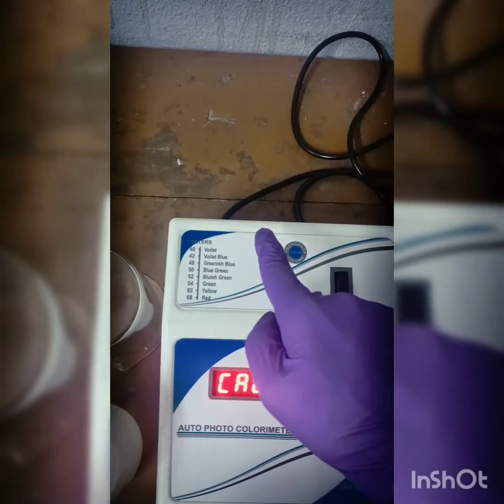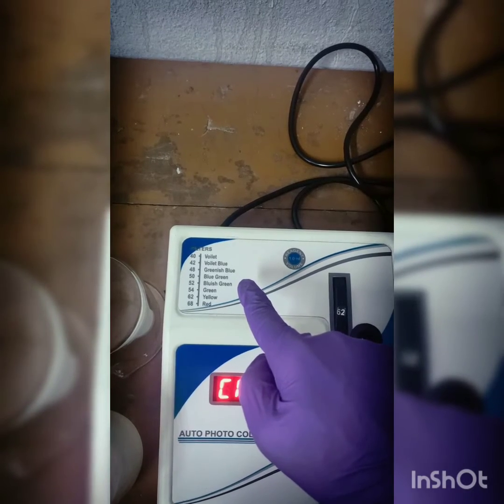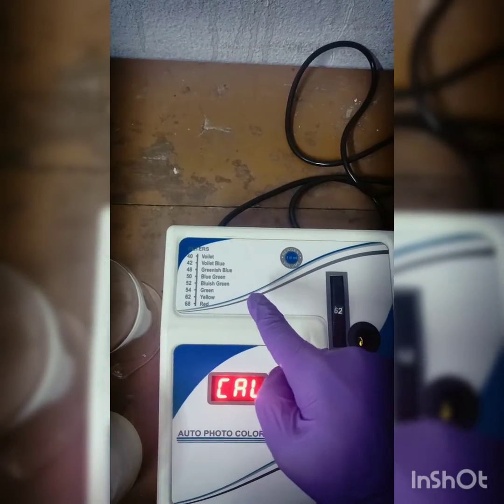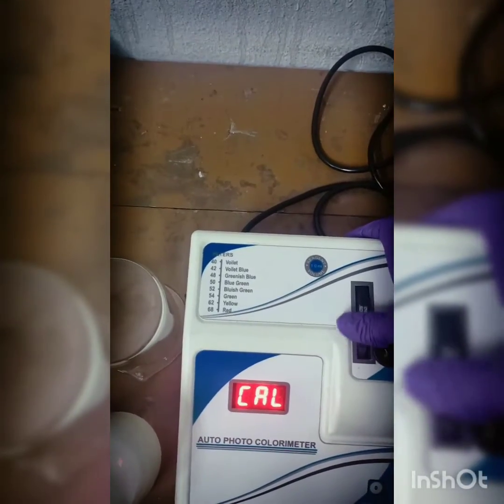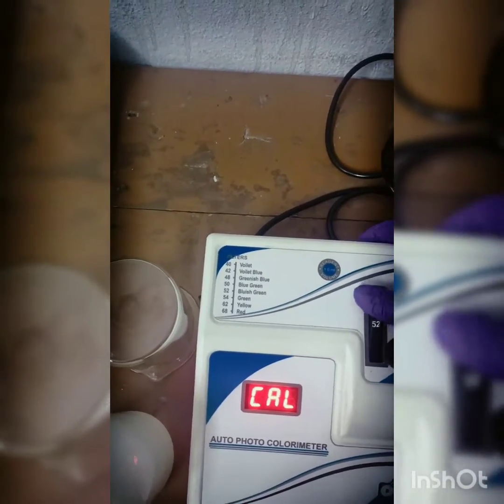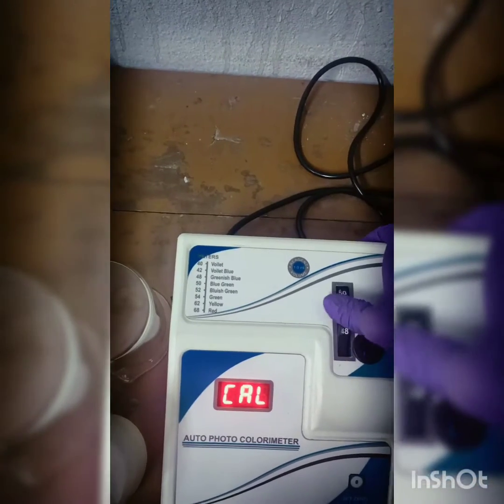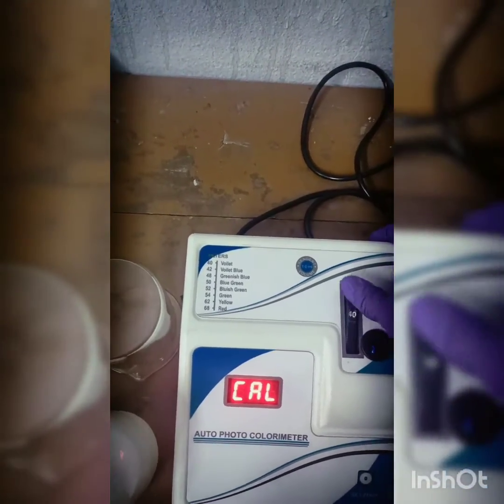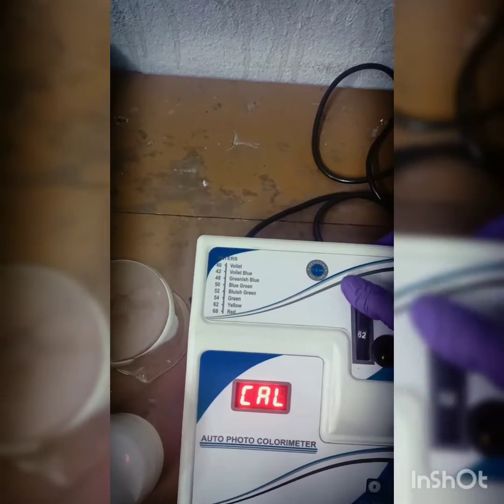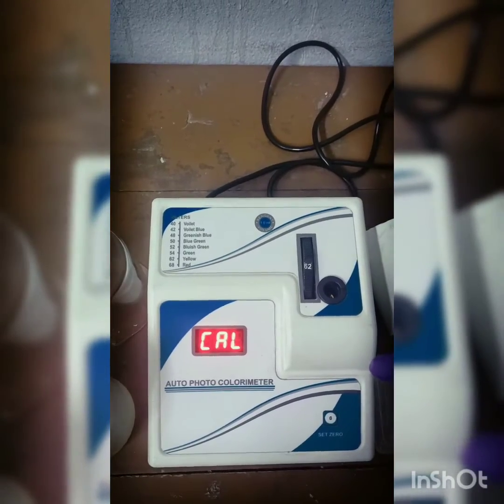Now here is the colorimeter and we have various wavelengths of light that are written above the colorimeter. So there are nanometers also given, that is 400 from 420, that is violet, and we need to adjust the particular wavelength we are looking for to determine the OD by moving this. And here you can see that I am moving that and I am setting 620 nanometer, which is for greenish and yellowish, because I will determine the OD of chlorophyll.